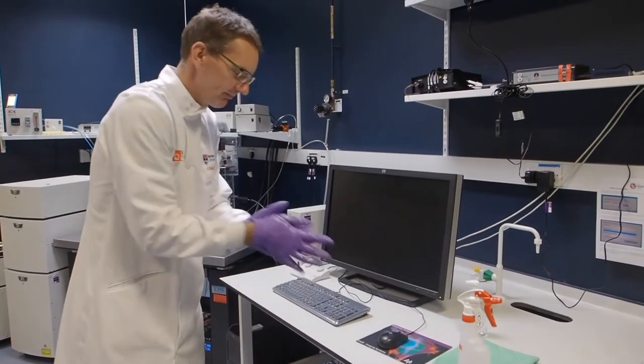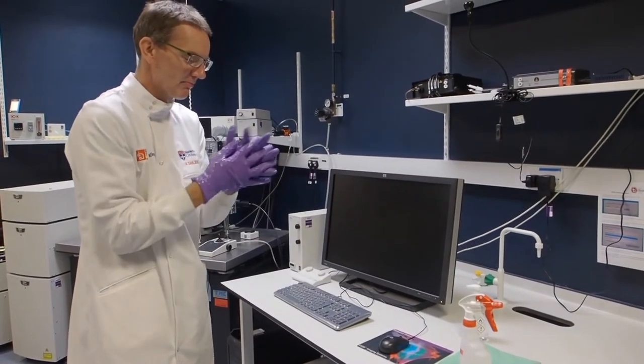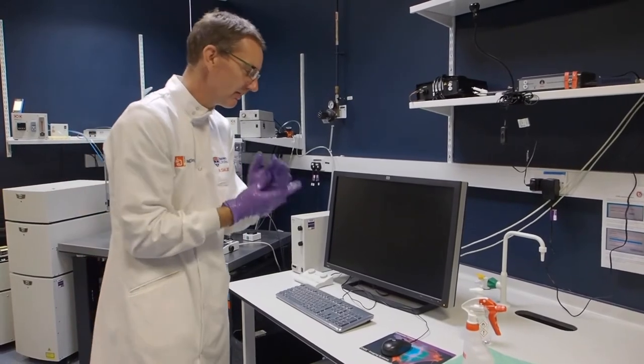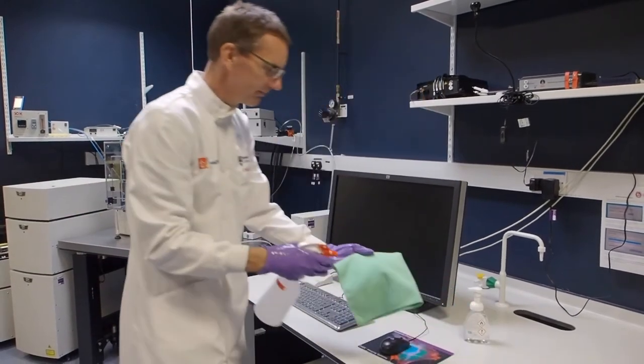Ensure you are wearing a lab coat and gloves. Spray your hands with 70% ethanol to make sure they are sterile before touching the system.